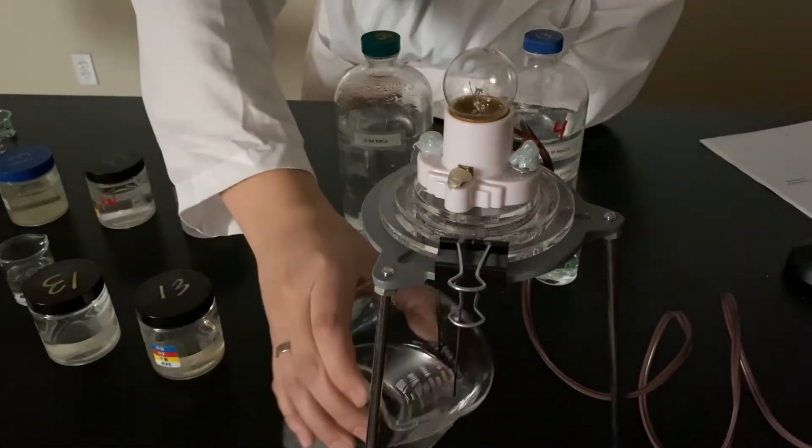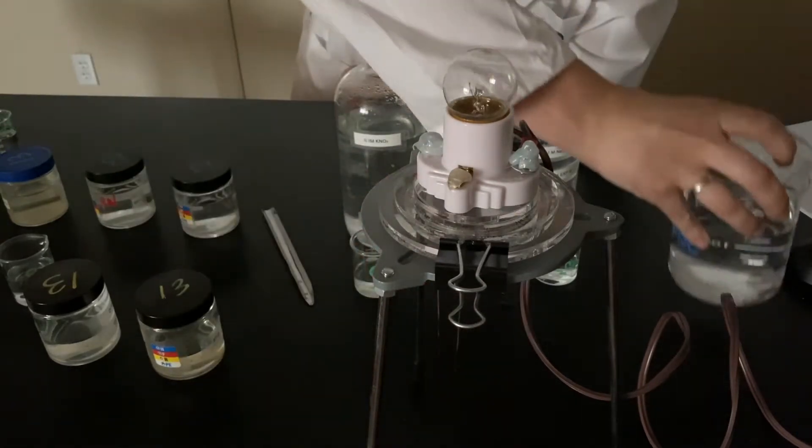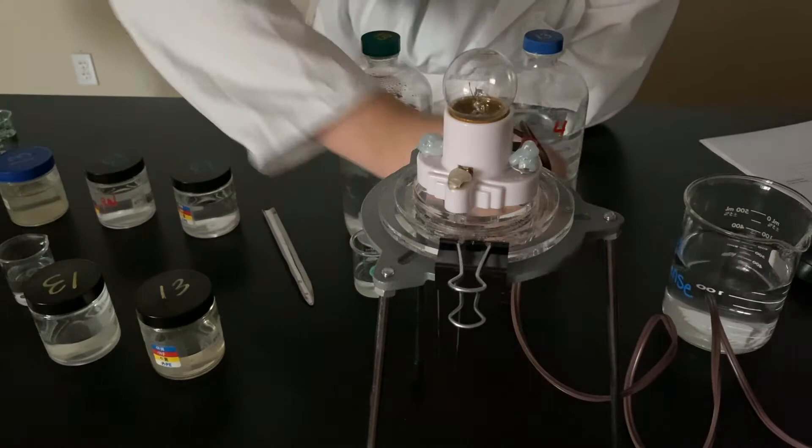D.I. rinse. And this is my sodium carbonate.